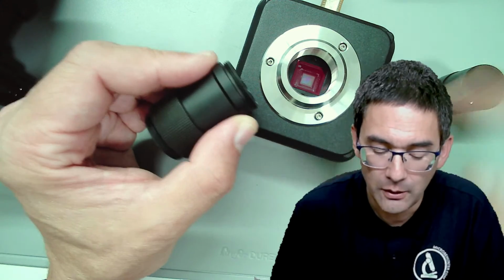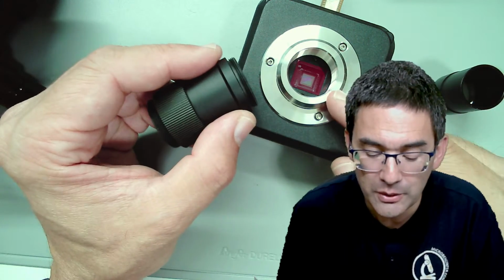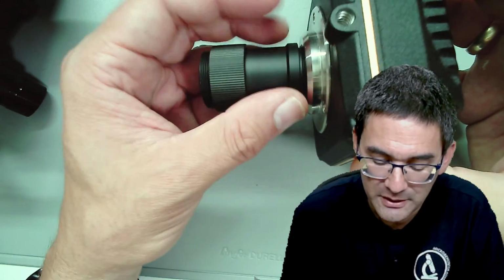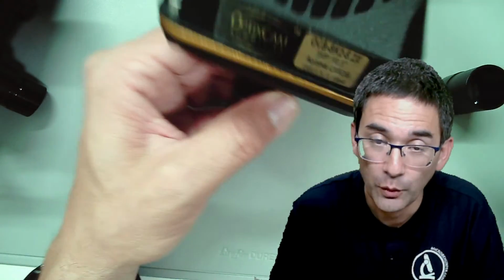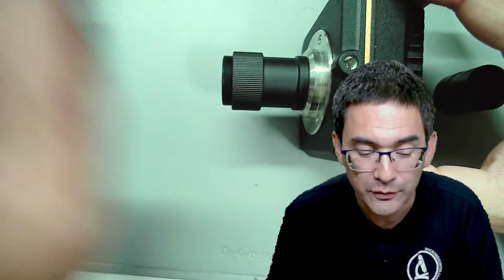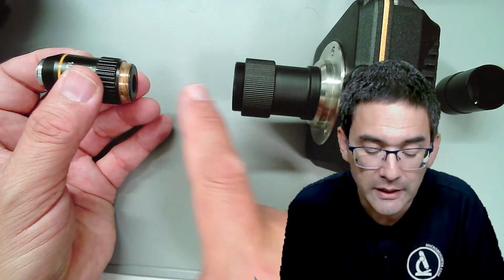Now this is a so-called C-mount. And this here is also a C-mount, and what you can do is directly, without the intermediate optics, connect the photo tube to the microscope. The whole thing becomes shorter, of course. And now you have a direct projection. Because there are no optics in between, the image from the objective lens is directly projected on the sensor.